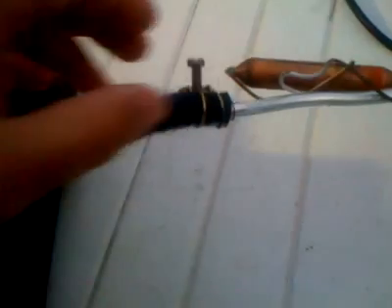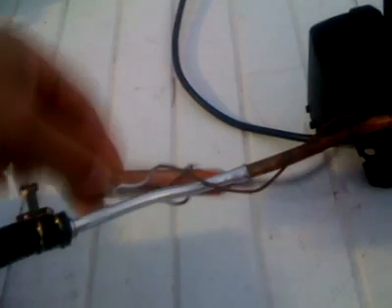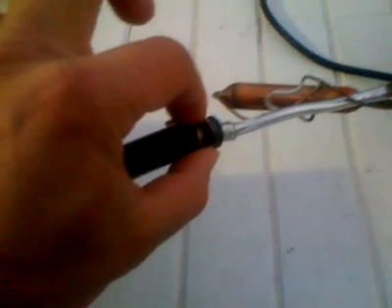Again, to emphasise the scrappy nature of this, this is the vacuum side of the compressor. I don't think this is happening at the moment, so I haven't chopped it off yet, but I don't think I need it. This has just been adapted by a bit of that same clear tubing that's underneath the test bed, and that makes it just the right size to press fit on my black silicone hose there, which is reinforced hose, so that just slips on nicely. Even though I've got a clamp on there, because it's such a tight fit and we're playing with a vacuum, it actually sucks itself on and stays there quite happily.